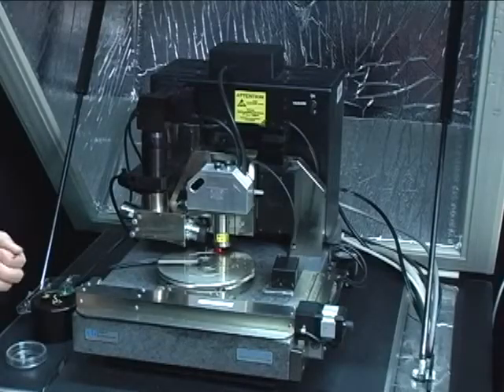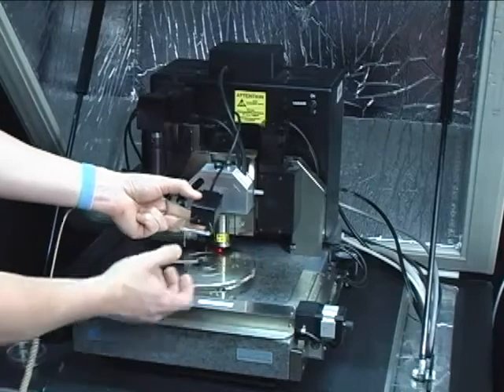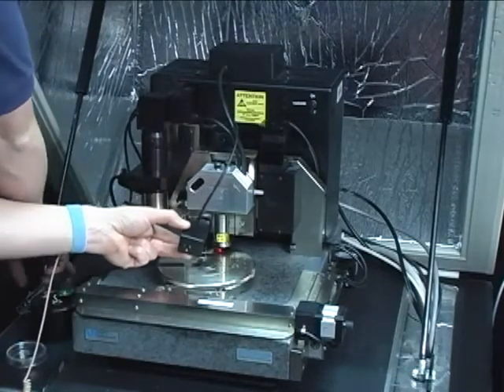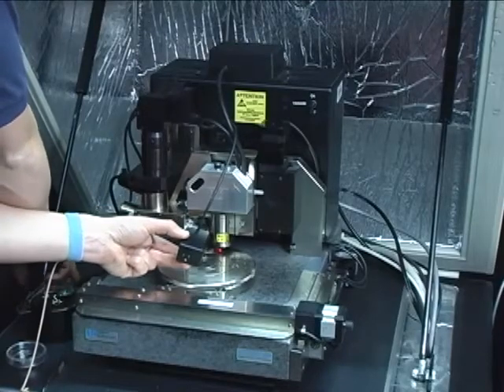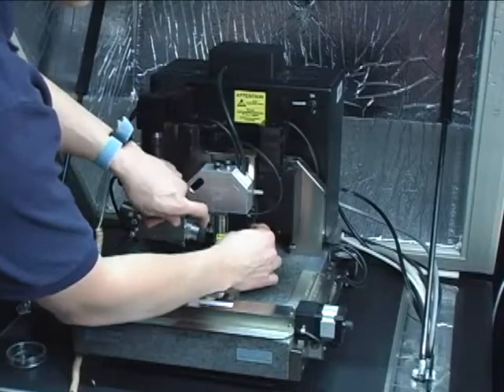So now that we have zeroed out the conducting tip module I can remove my calibration resistor. And mount the module to the side of the scan head.